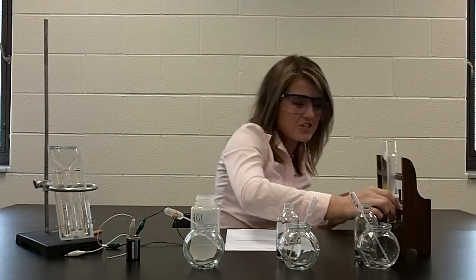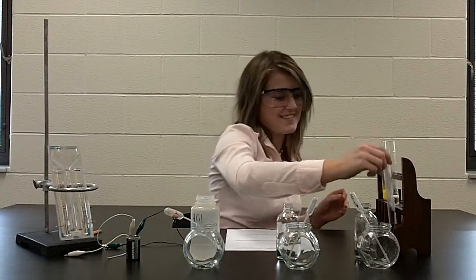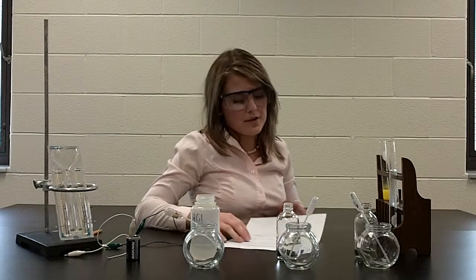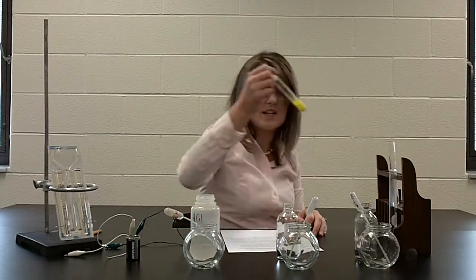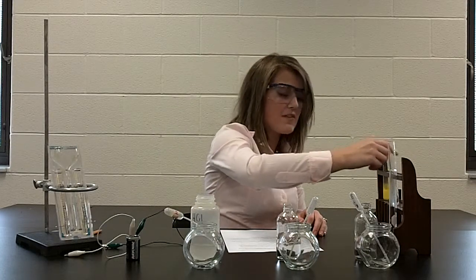So that is our procedure for this lab. As you can see through here, we have some heat, we have gas being formed. And again, with our Big 4 official terms for evidence of a reaction that we saw in this lab, you have bubbling, which is a gas formation. You have a precipitate, which is a solid substance being formed, we have color changes, and we have heat generation.